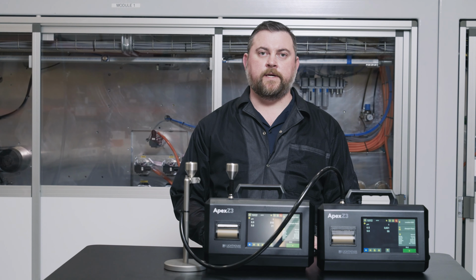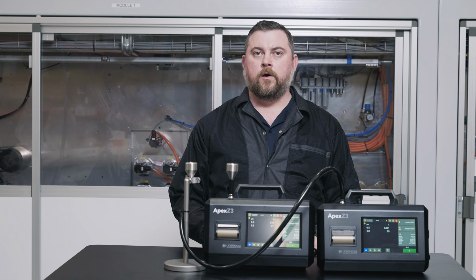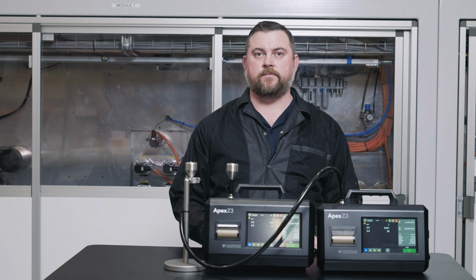In the SOP, we mentioned that you need at least 100 particles per channel per sampler. If you find that your counts are below that number, you can either move to a more dirty environment, like an unfiltered office room, or you can use an aerosol generator to get those counts a little bit higher so that you can achieve statistical significance.